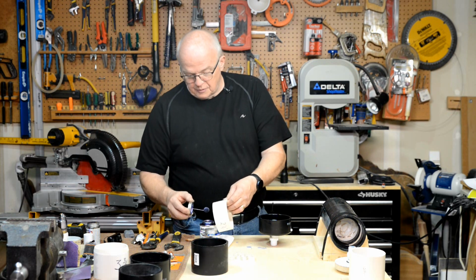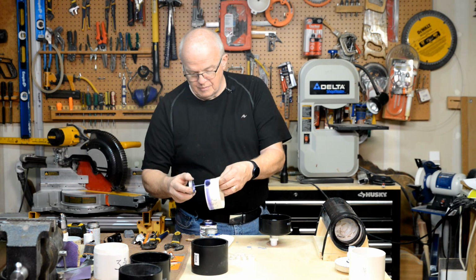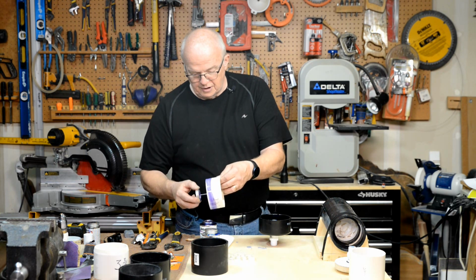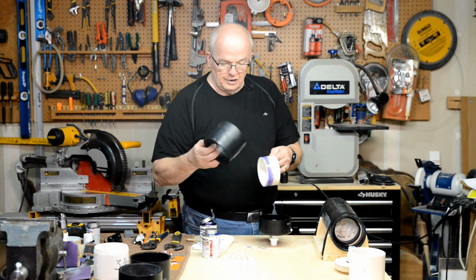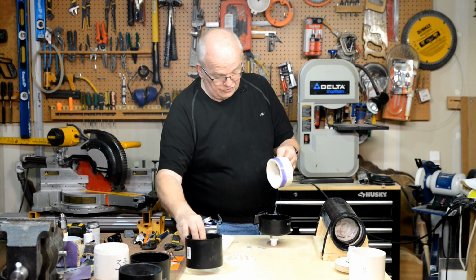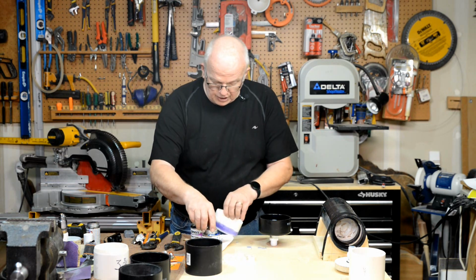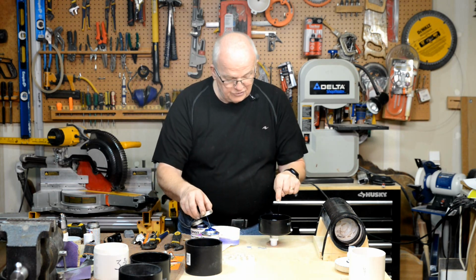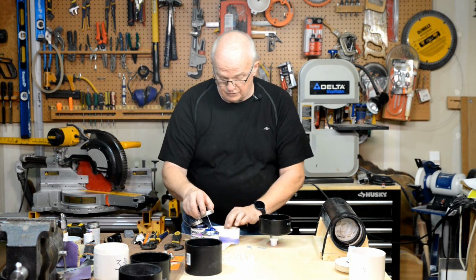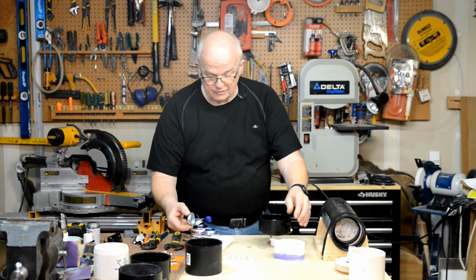Okay, now this one, you're going to want primer around this outside edge. Not too far up, only about 1 inch, and I'll show you why. You don't want it so far up that you're going to glue it onto this. Not yet, anyhow. So now I'm going to take my adhesive, and I'm going to put the adhesive in here and only in here. Do not put the adhesive on this, because you don't want squeeze out yet.